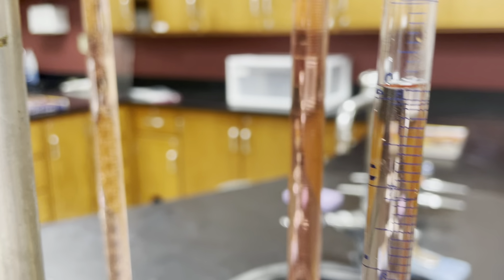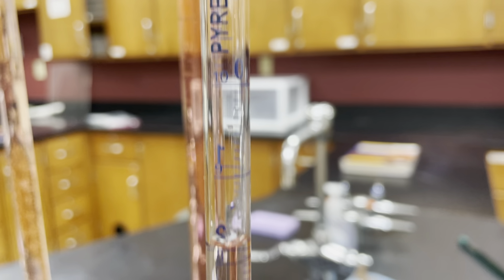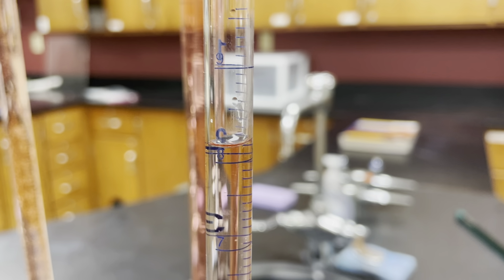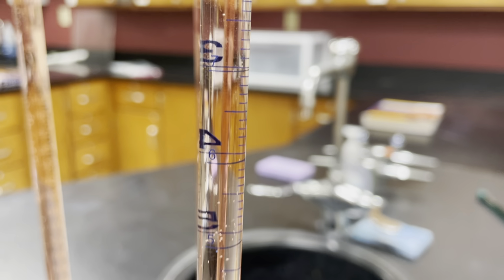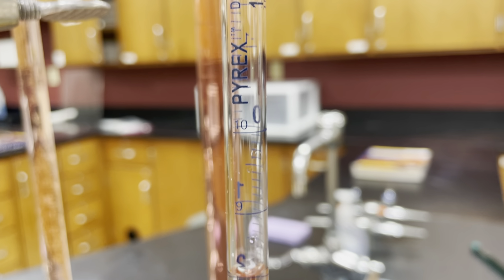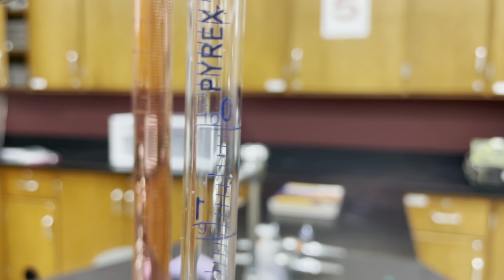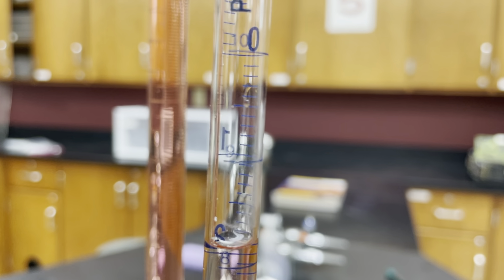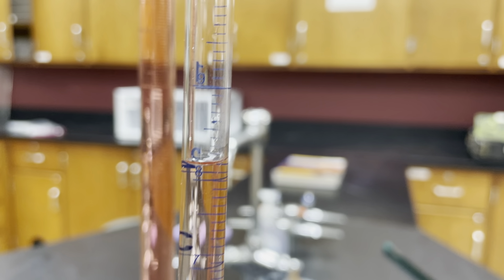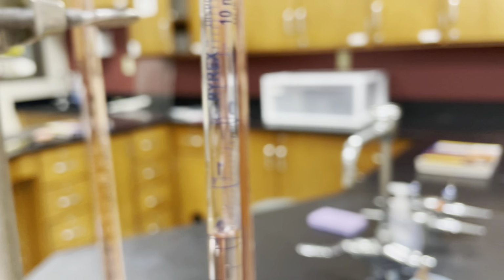So on this side, where we're counting upwards with how much volume we're containing, this is really good at figuring out the volume at very specific milliliters. So like at 1 or 2 or 3 or 4 or 5 or 6 or 7 or 8 or 9 or 10. But as far as something in between, it doesn't really tell us. Again, you could try and go with the numbers behind, where you've got the 0 and the 1 and the 2, but those are meant for how much liquid you're dispensing, and they're not on the same side as the counting up numbers.